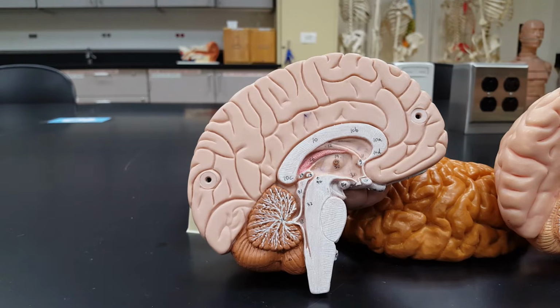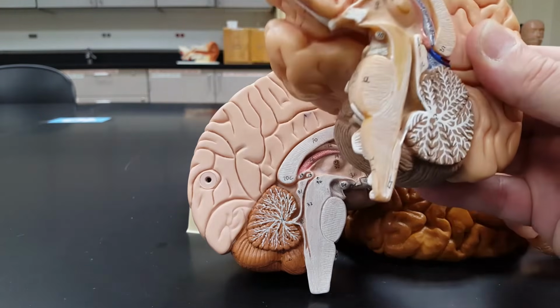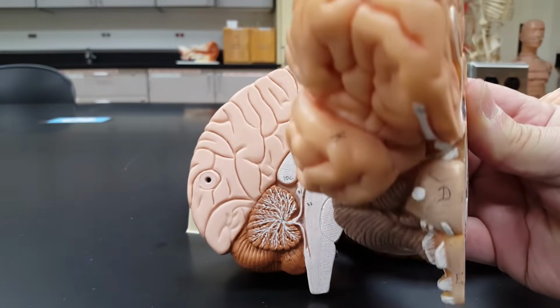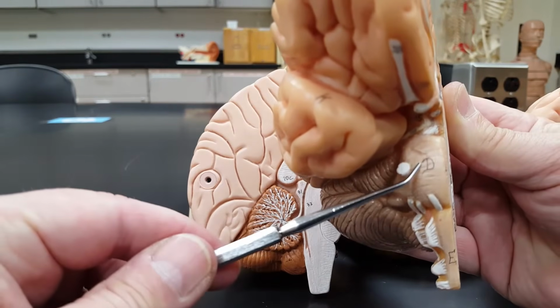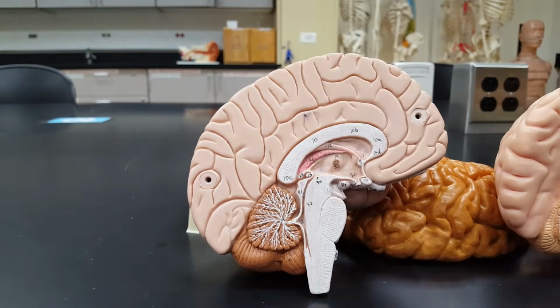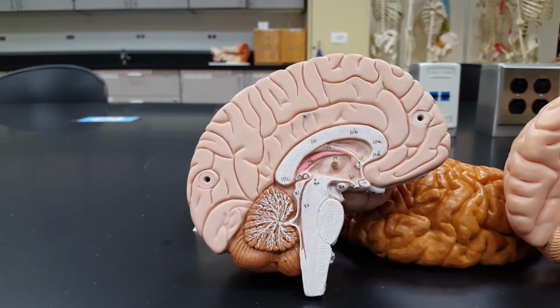So, if we look at the front of the medulla oblongata, so see this brain is looking directly at you. Right here is the pons, right here is the medulla. Somebody looked at this in the front and thought it looked sort of like a pyramid. I don't know that I buy that, but let me try to show it to you on a couple different models.